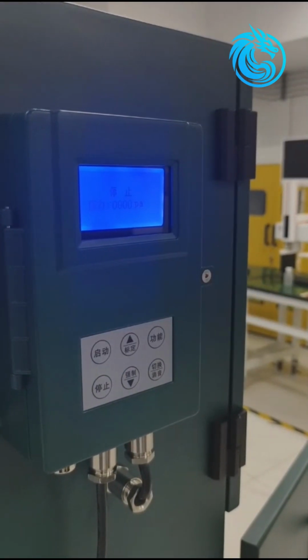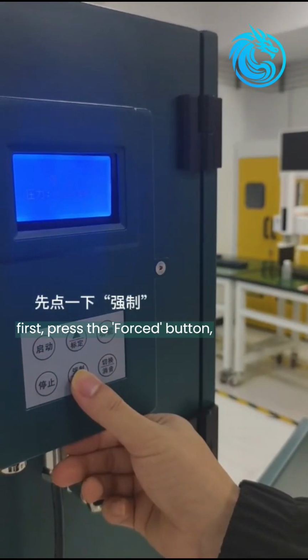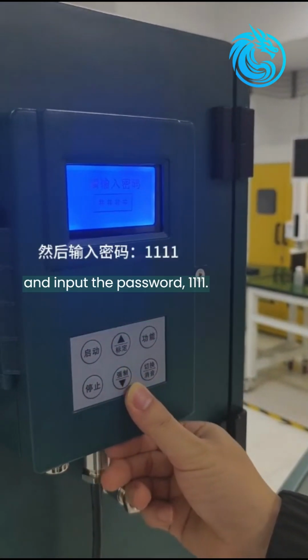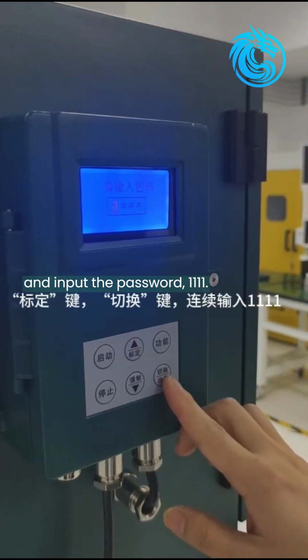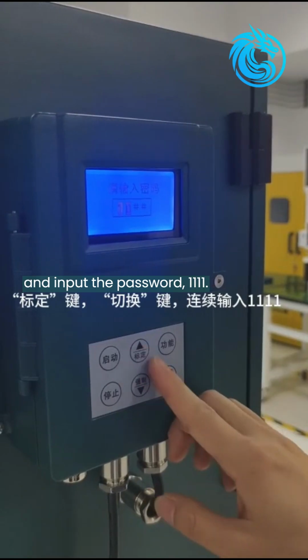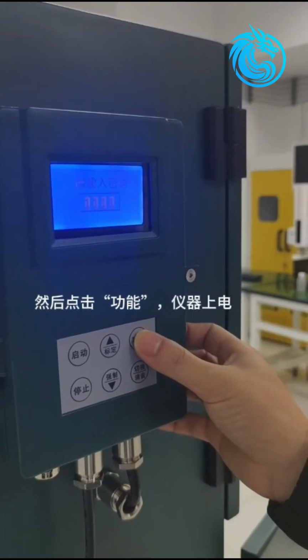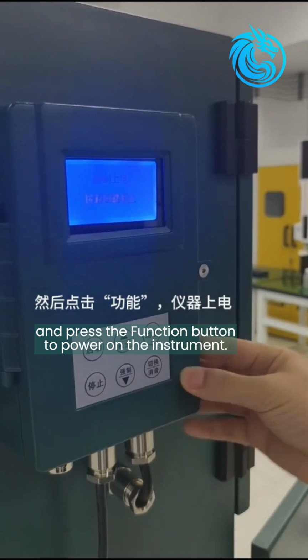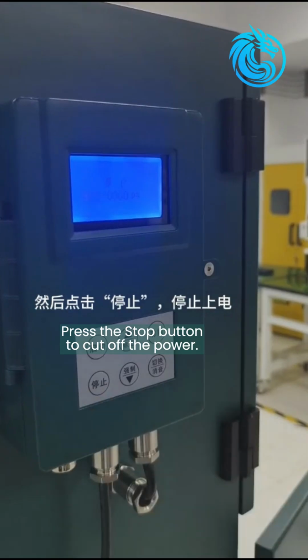To initiate a force power-on, first, press the force button and input the password 1111. Using the calibration button and the switch button, continuously input 1111 and press the function button to power on the instrument. Press the stop button to cut off the power.